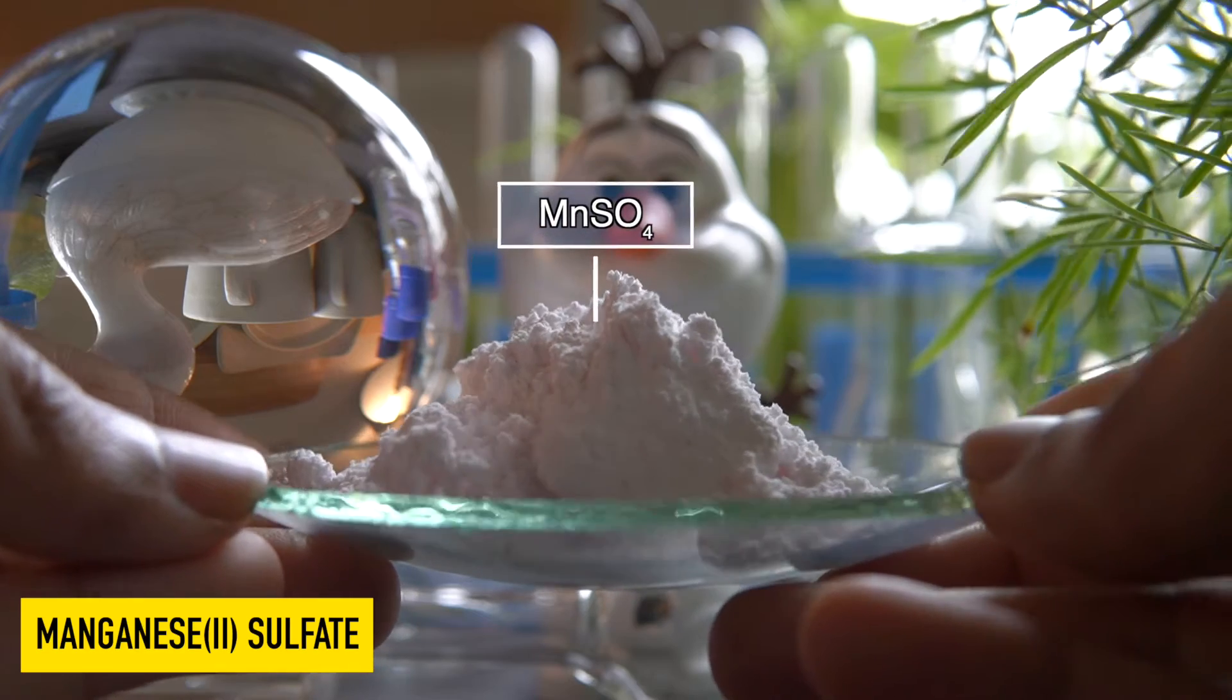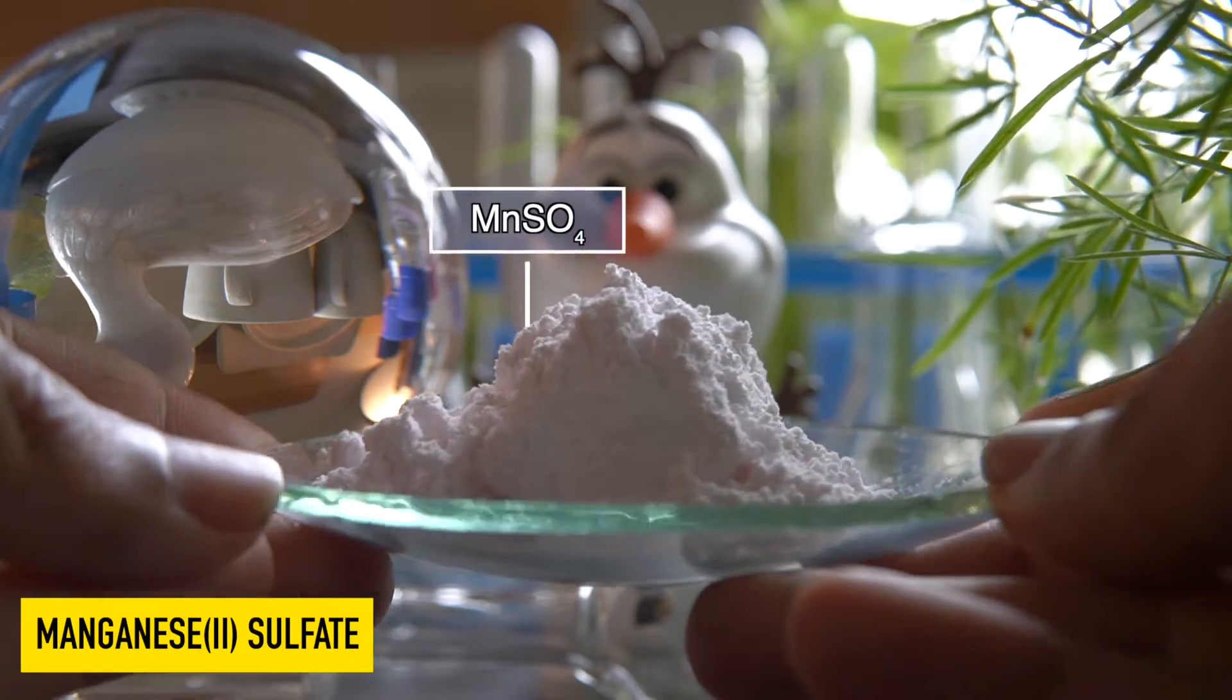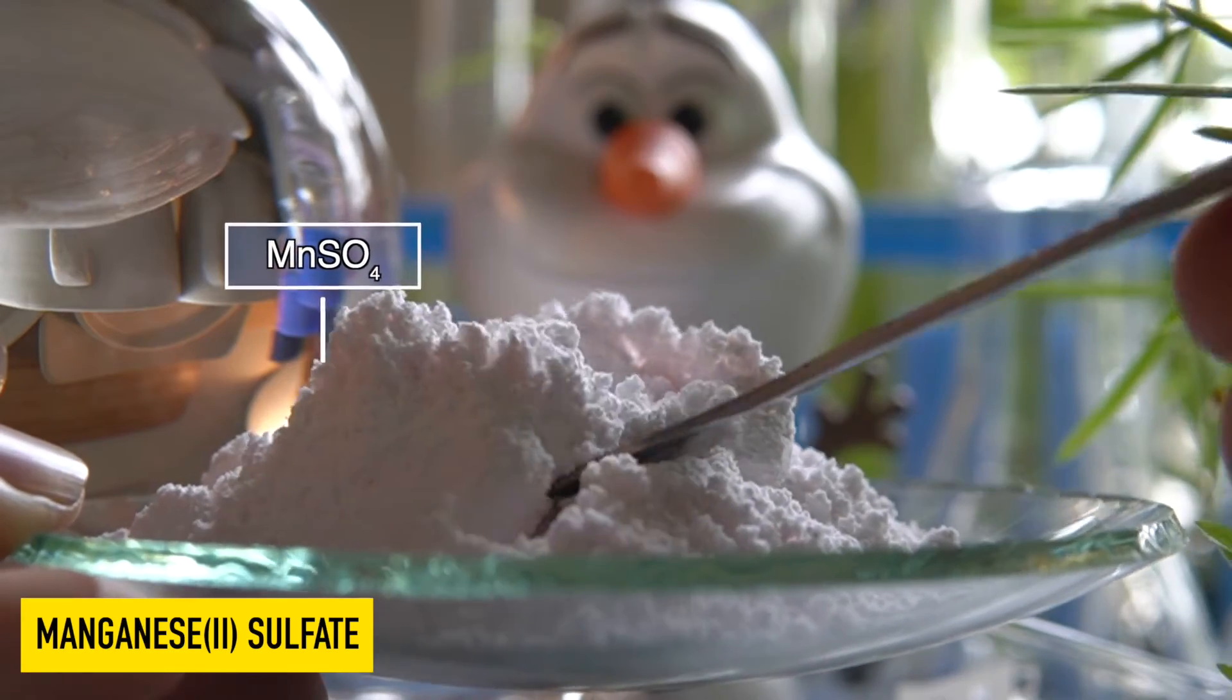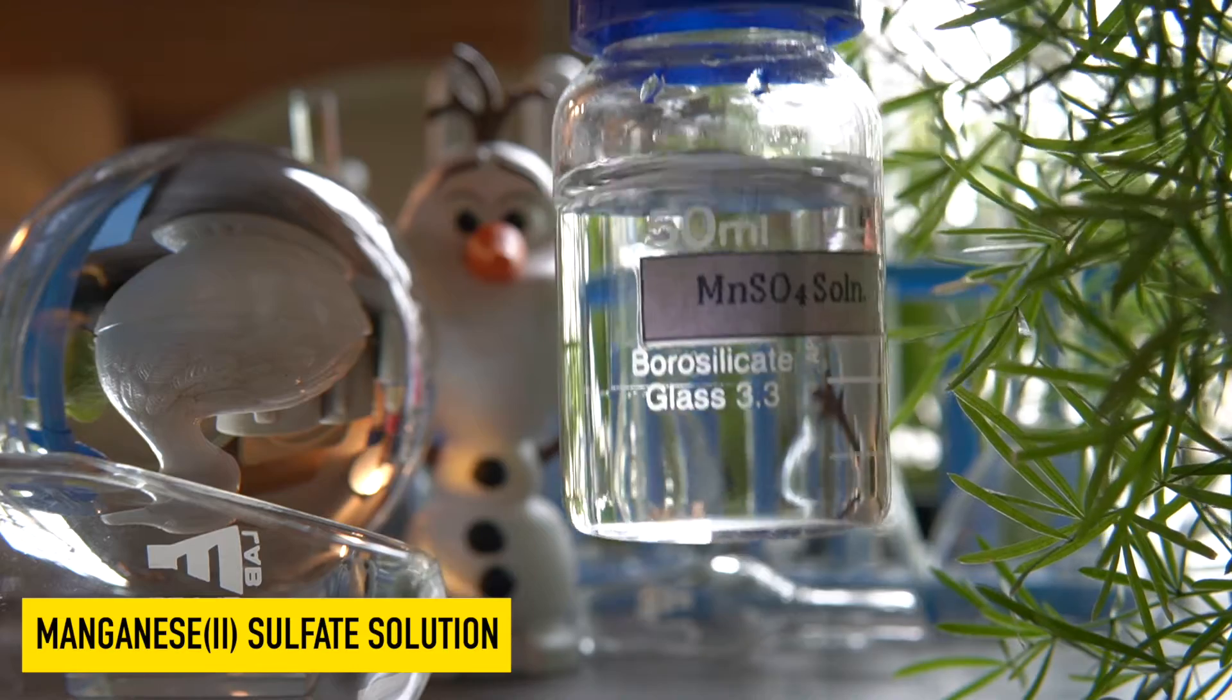This is MnSO₄ salt, slightly pinkish in color and highly soluble in water. It can easily dissolve in water to make a homogeneous solution.